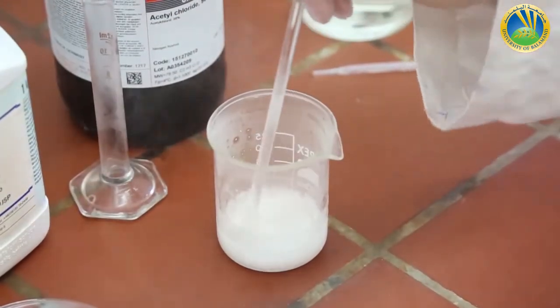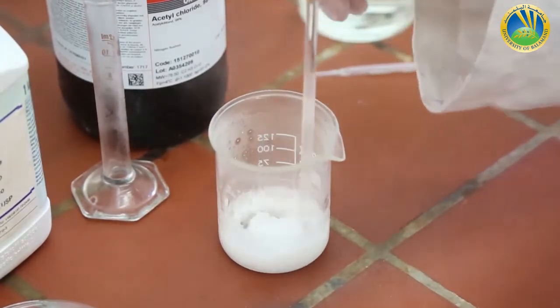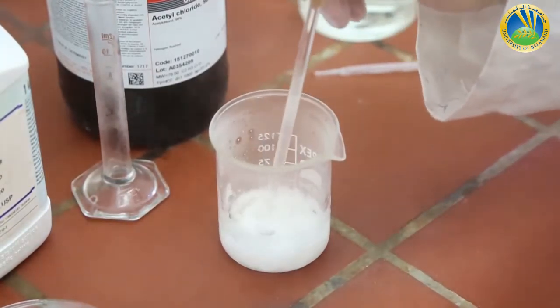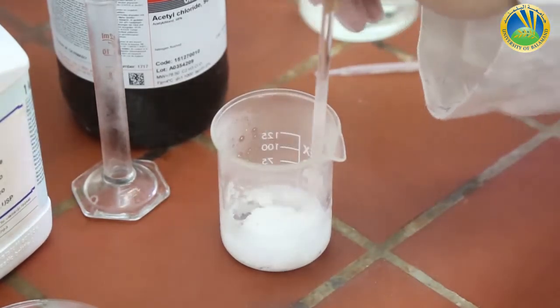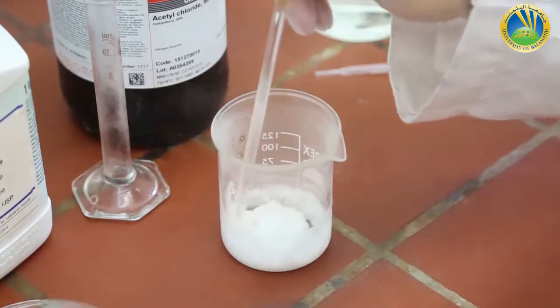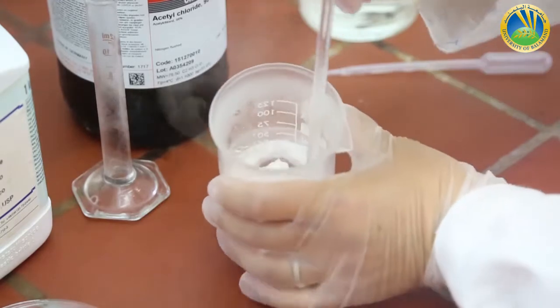I have to keep stirring for a few minutes until I see the formation of the white solid, which is the acetylsalicylic acid or aspirin. Are you seeing the formation of those crystals?